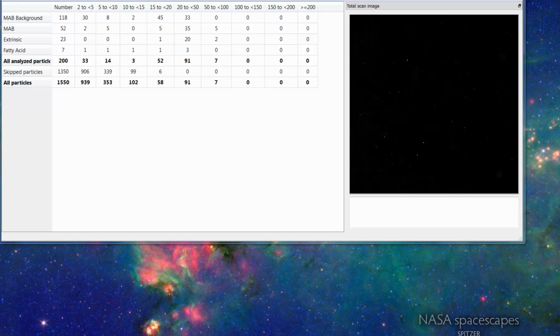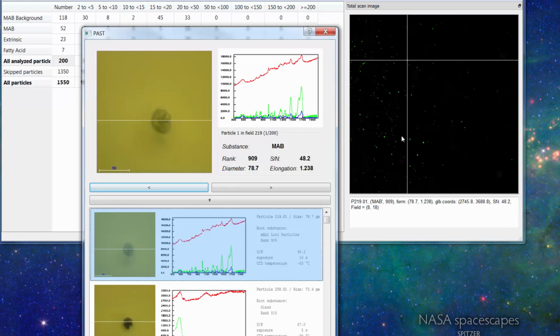So this is just a quick overview about how we work with the data after we recorded it. What you look at here is a 300 microliter sample dispersed in the wet dispersion aid of the SPE, the single particle explorer. We have measured in total 200 particles on that surface here. Since we had a highly concentrated monoclonal antibody solution, some of those particles represent agglomerates of that very same monoclonal antibody.